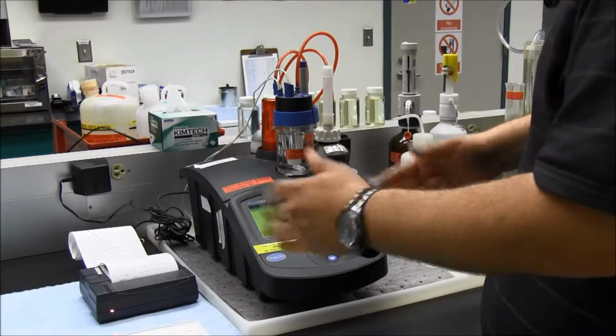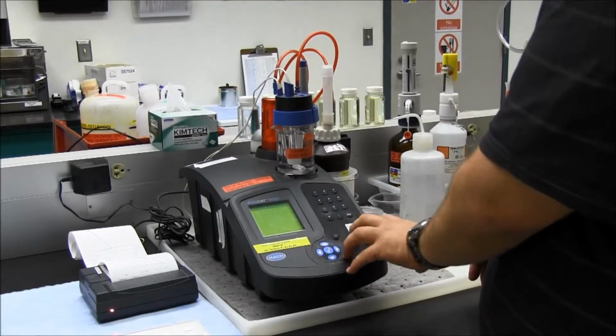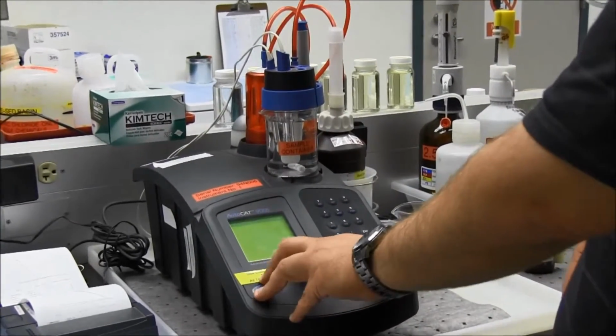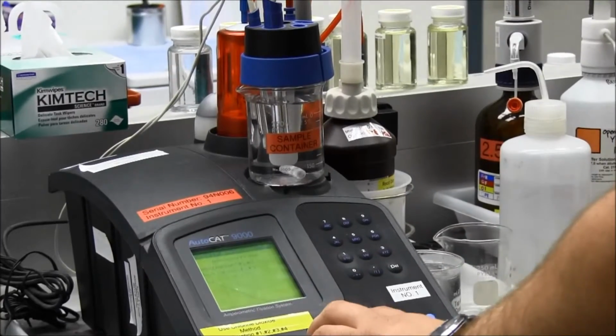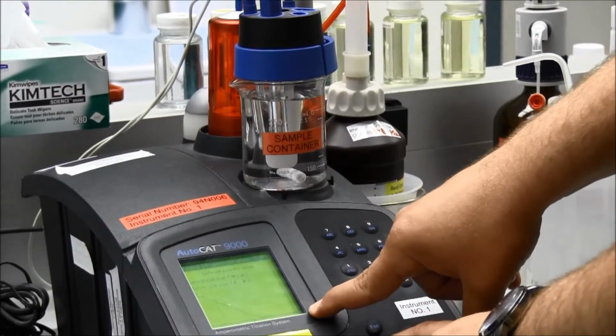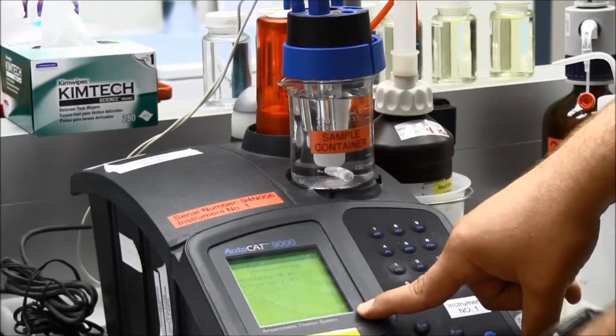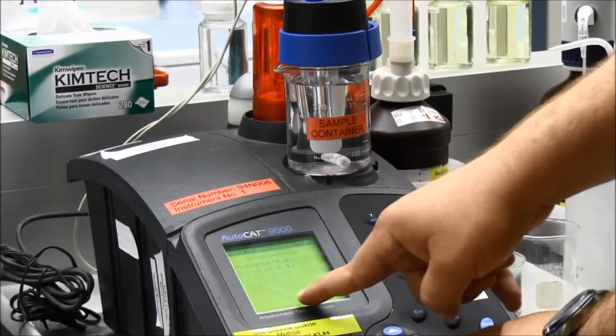I'm going to adjust the cursors to find the endpoint and take a snapshot of the data points. So I'm going to hit delete for manual edit. I'm going to come in here again. I'm going to adjust my last cursor first. I'm going to bring it almost all the way out to the end. I'm going to go to my third cursor. I'm going to move that just past the endpoint.